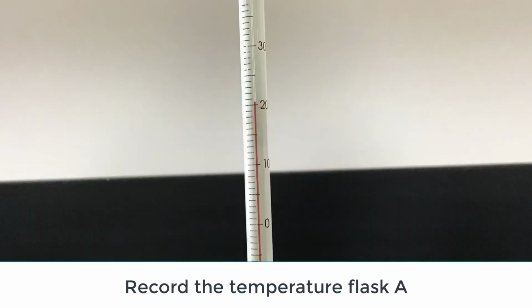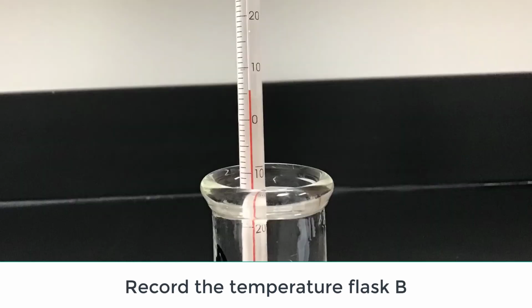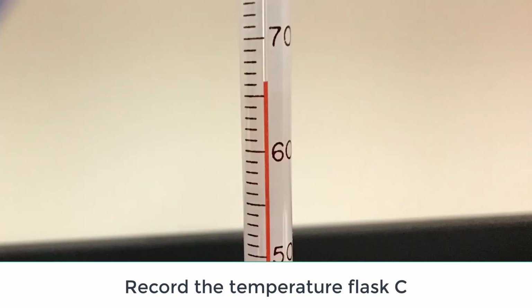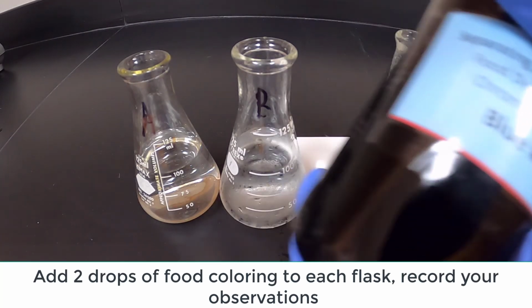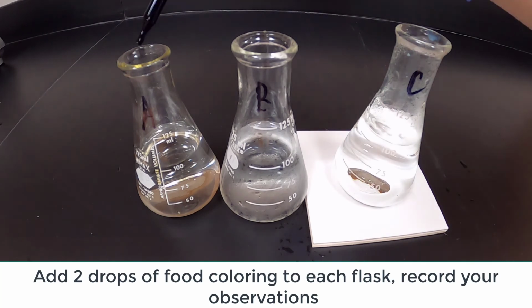Record the temperatures of flasks A, B, and C. Add 2 drops of food coloring to each flask. Record your observations.